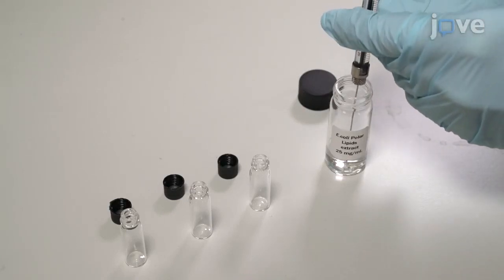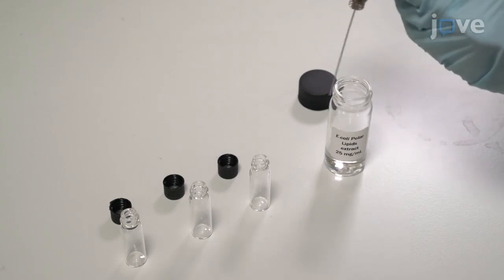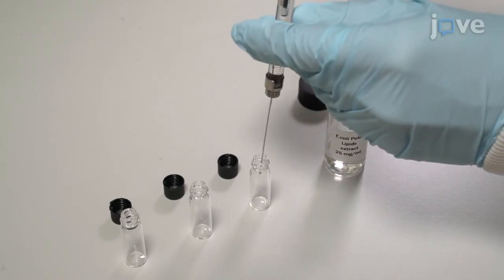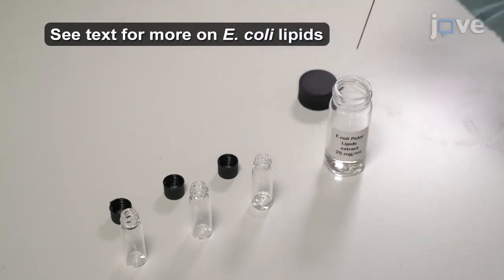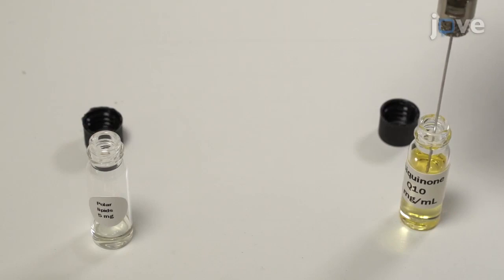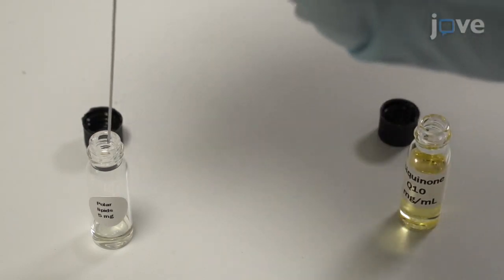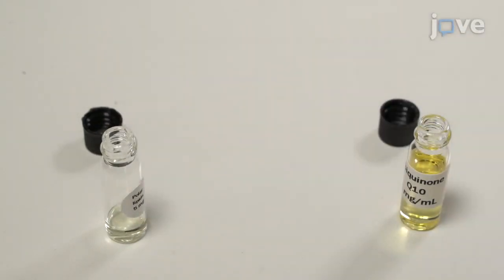Using a glass syringe, transfer 200 microliters of chloroform stock of lipid polar extract from Escherichia coli into glass vials to make 5 mg aliquots. Add 50 microliters of 1 mg per milliliter ubiquinone 10 to the lipids to make the final ratio of 1 to 100 ubiquinone 10 to lipids.